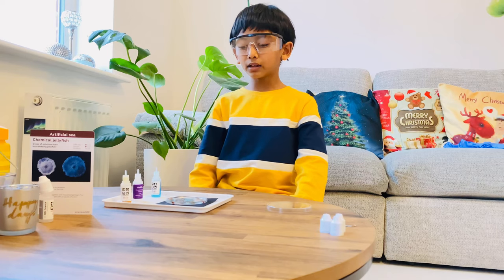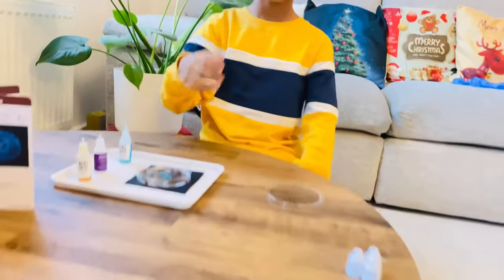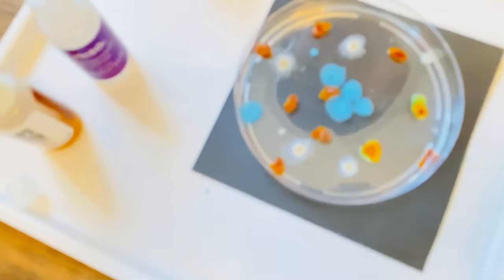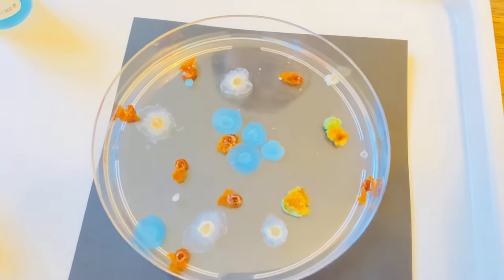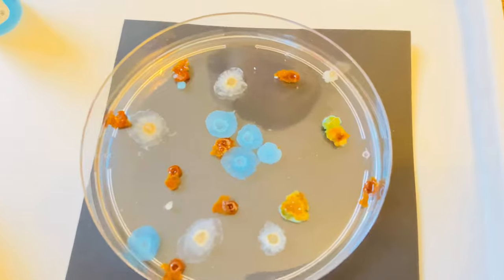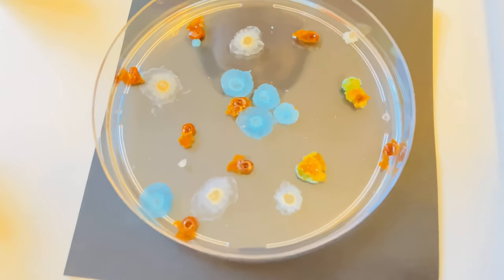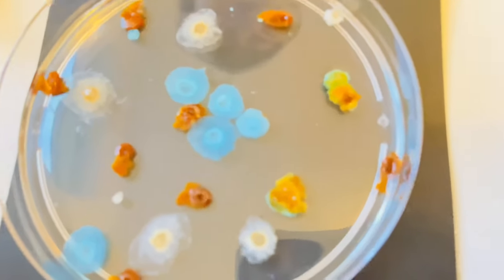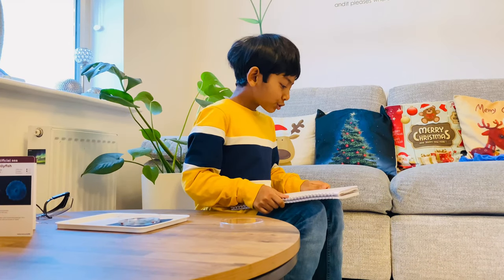It's been three minutes now and they've formed into jellyfish — come closer, these are beautiful! The manganese sulfate and the copper sulfate look good. The blue ones are copper sulfate and the brown ones are iron chloride. They look like jellyfish, but I didn't like the brown ones — they don't look like jellyfish.